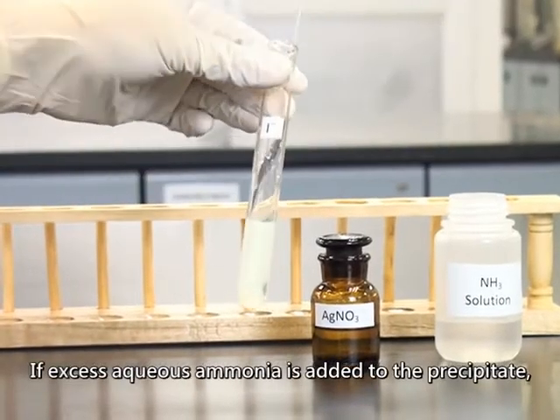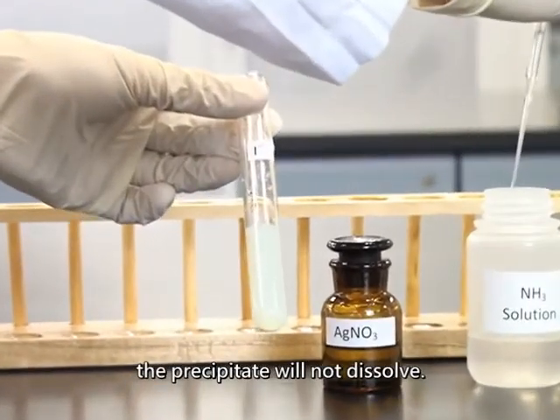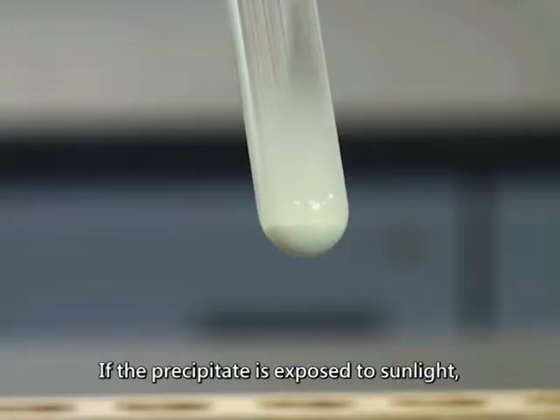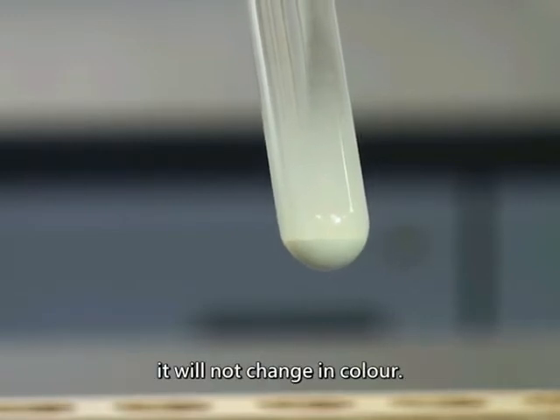If excess aqueous ammonia solution is added to the precipitate, it will not dissolve. If the precipitate is exposed to sunlight, it will not change in color.